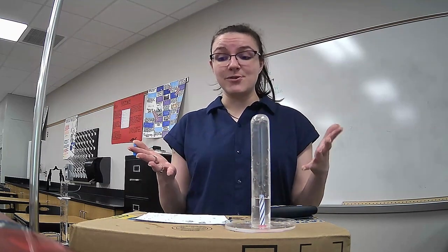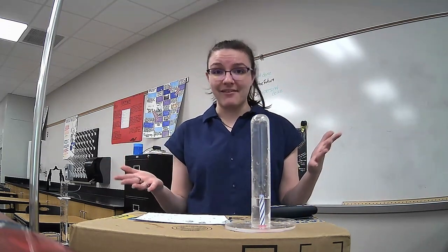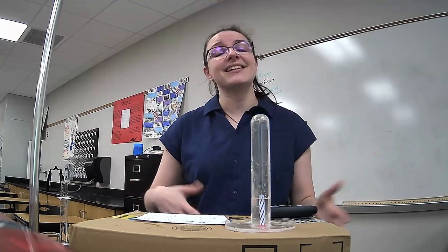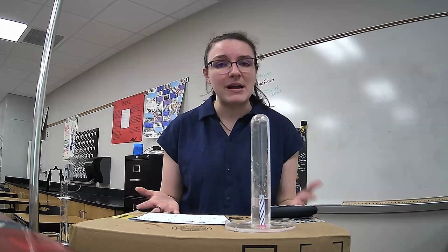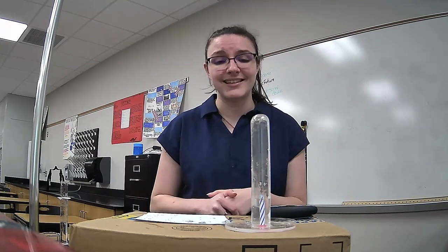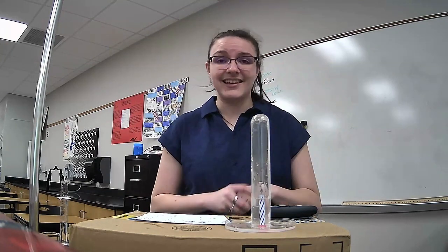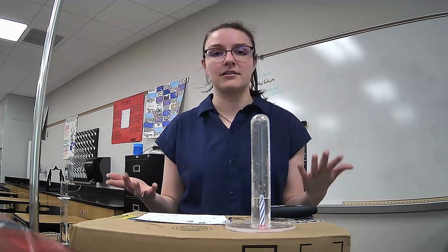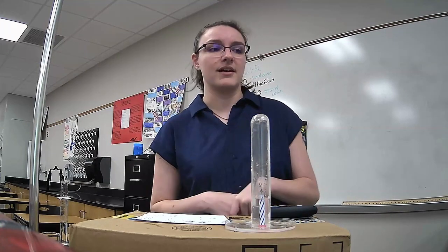We really, though, getting an average of 27%, 26.67, is about as good as we're going to get. Again, the actual amount is about 21%, and that candle is taking up space. So we were spot on with what we can expect this kind of experiment to give us.